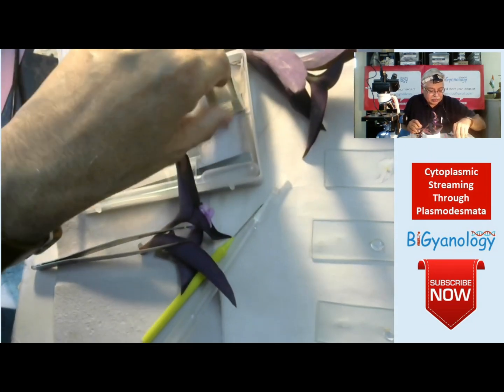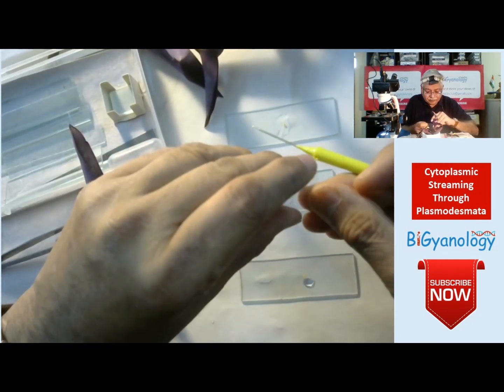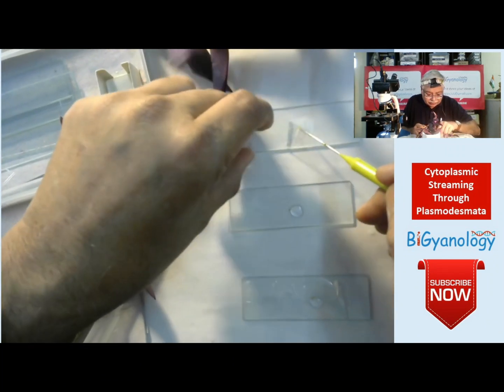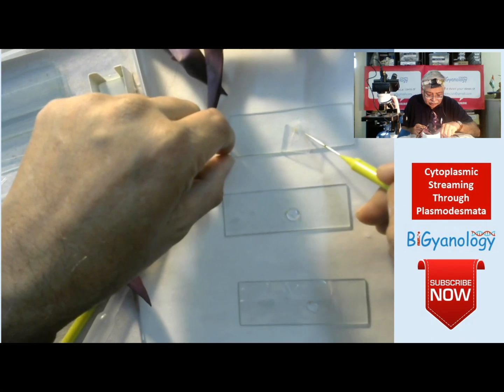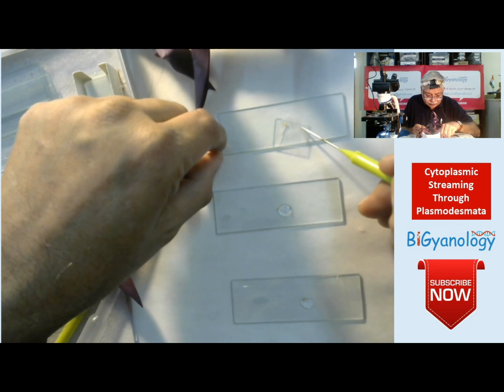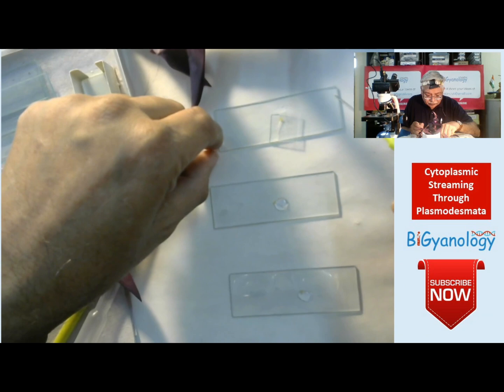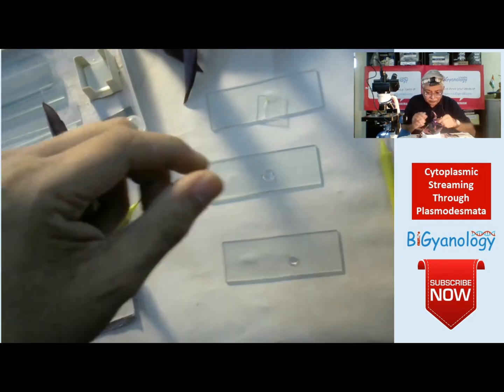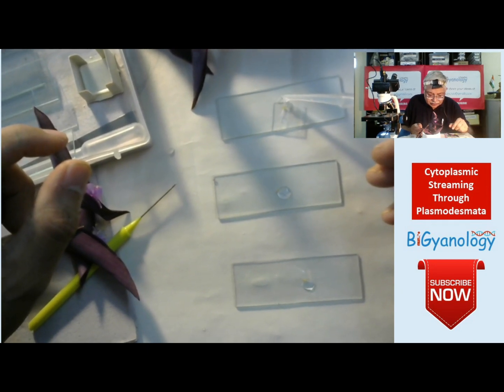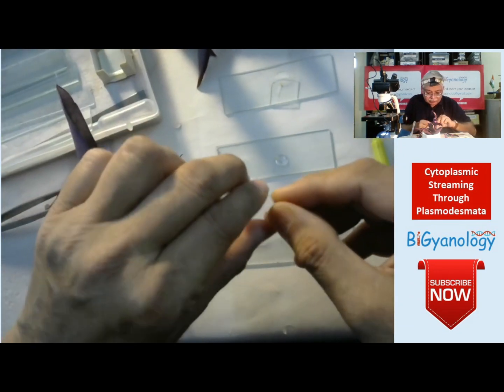Now I will take a coverslip for each one. When we are putting the coverslip we have to be very careful not to crush the hair. The water is less so I am adding some more water on the side. The second one also I am putting it.